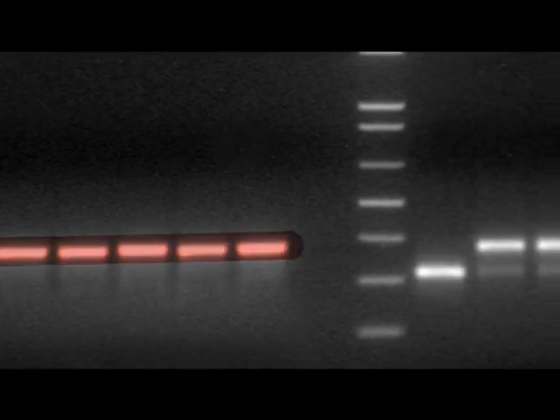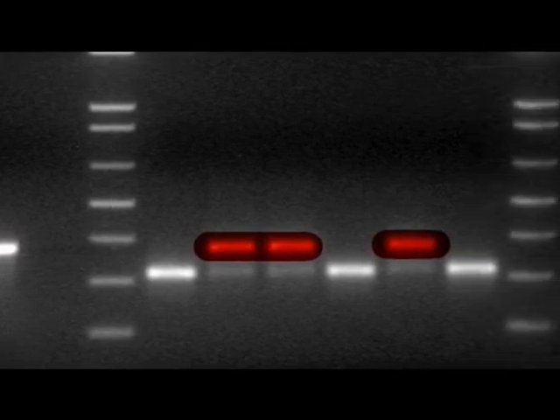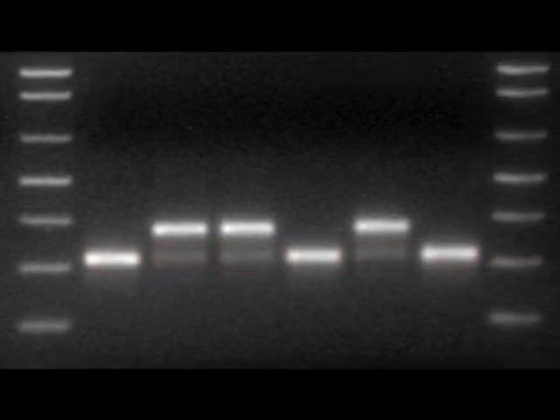On the left are samples of the uncut PCR products, which are a little under 400 base pairs long. On the right are samples of the same PCR products after digestion with restriction enzyme. In three of these lanes, there are bands that are the same size as the uncut PCR products. These are the W chromosome fragments that HaeIII could not cut. The birds that these samples came from are therefore female. In all of the lanes is a smaller band, a little bigger than 300 base pairs. This is one of the two pieces of the cut Z chromosome DNA fragment. The other piece is very small, around 60 base pairs, and cannot be seen on this gel. We have now identified that three of these samples came from female birds, and three came from male birds.